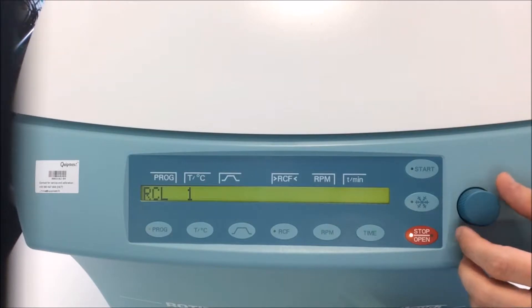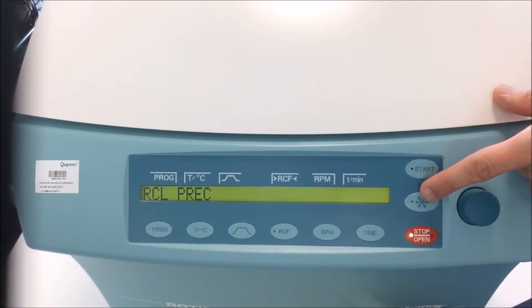It's going from 1 to 98. The 99 is the pre-cooling program. It's linked to this button, and we cannot change it.